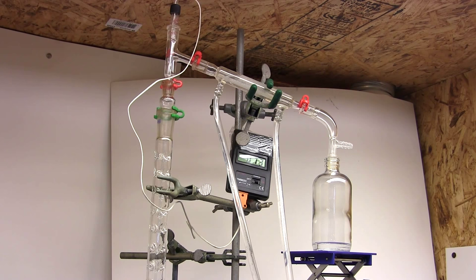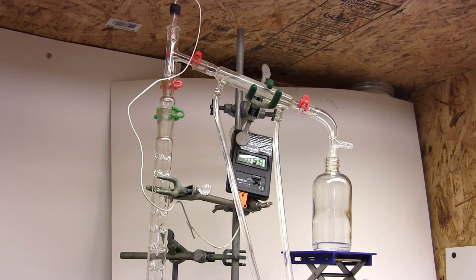Well that sucks, now it's going too slow and not reaching the top of the column at all. And yet I only dialed back the heat a small amount. This can happen with distillations where the column loses too much heat and completely condenses out before the vapors can exit at the top.